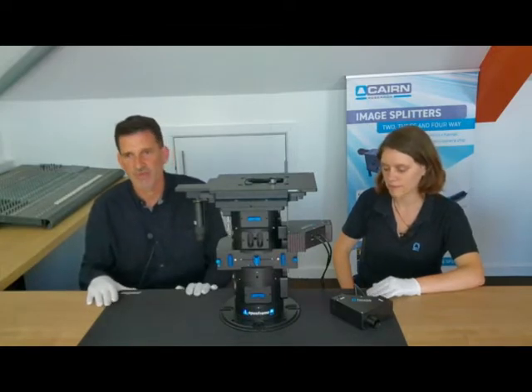We're now going to show you another microscope that we've made specifically for being rather simple and compact, and it has a few additional features that we haven't covered so far.